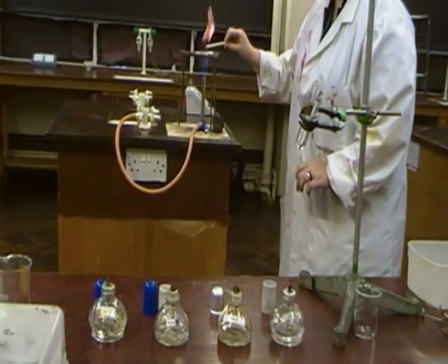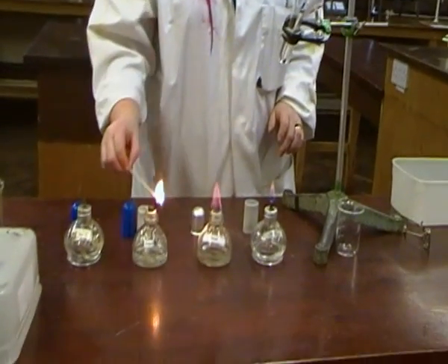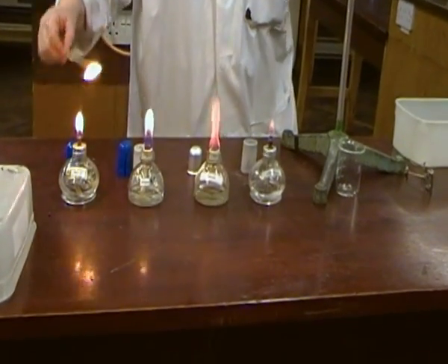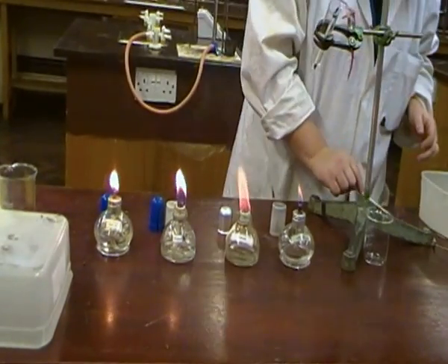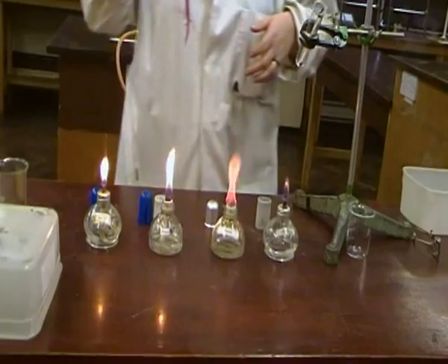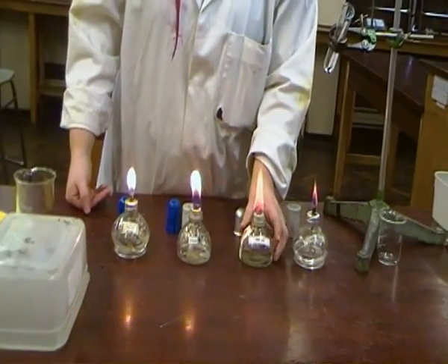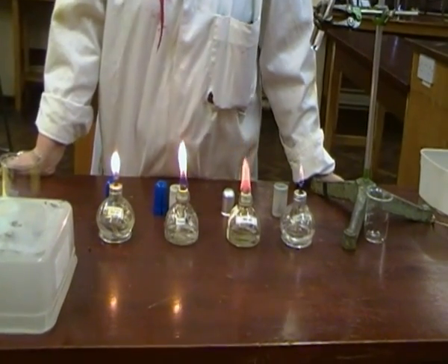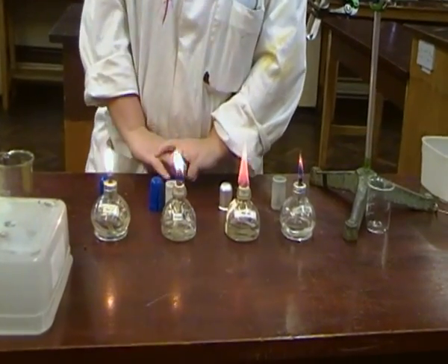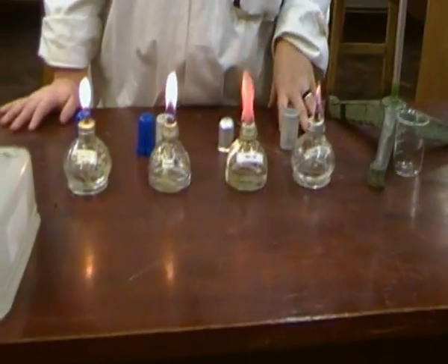Right, so let me just light them so that you can see the different ones. Alright, so you can see that they are fuels, and they are liquid, colourless fuels, extremely flammable and toxic. You may be asked to give them a hazard warning sign. The extremely flammable one is the fire one. Sometimes you may want to give them toxic as well, but I suggest if you have to choose, use the flammable one. Alright, so there you are, you have the four burning.